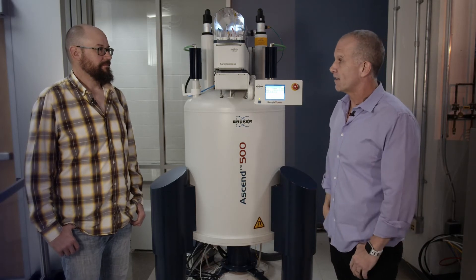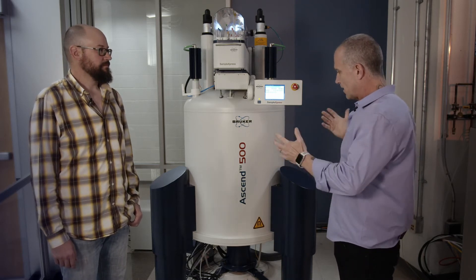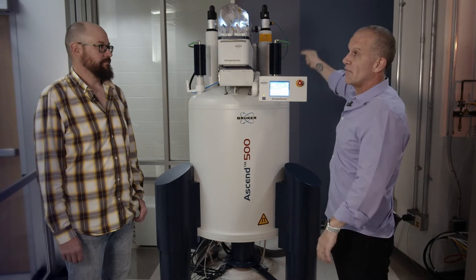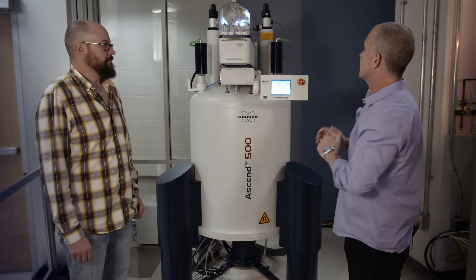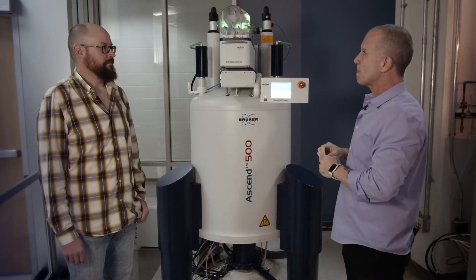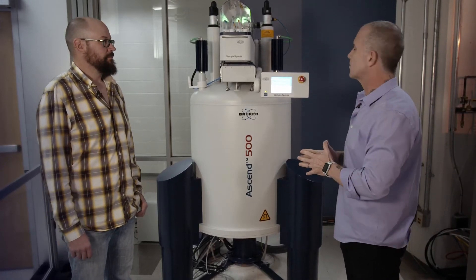Now they're just waiting on their data, but I thought we would take a little time and look at the instrumentation itself and discuss the different components of an NMR beyond what a common user deals with — which is just inserting the sample into a magnet. Starting at the top, while my interface with the NMR is primarily getting a sample into the magnet, there's a lot of other things going on, and I'd love for you to take a little time and explain it to us.